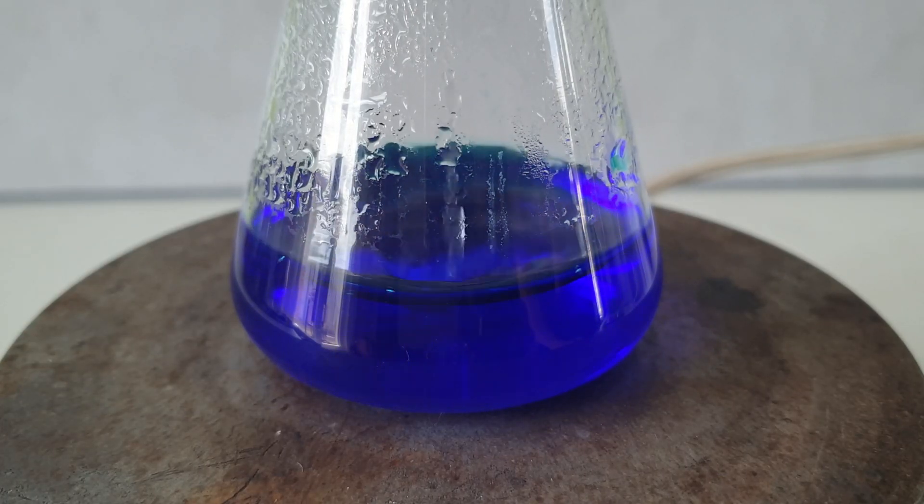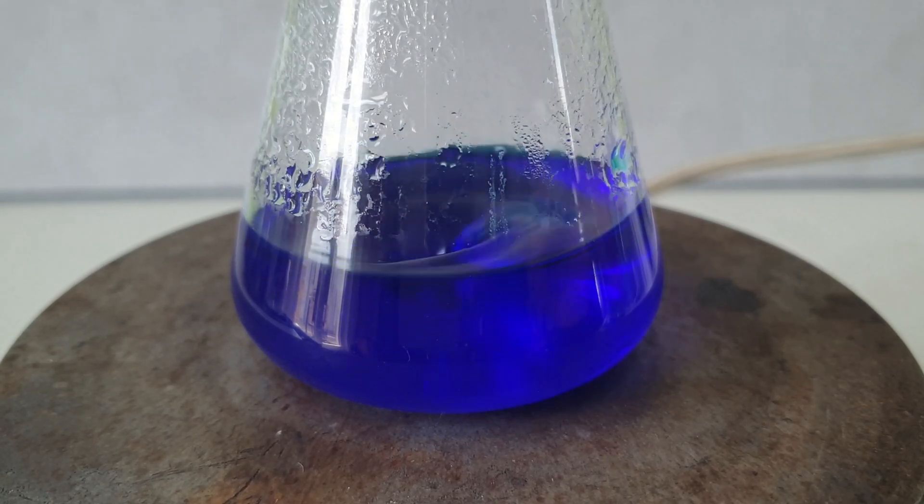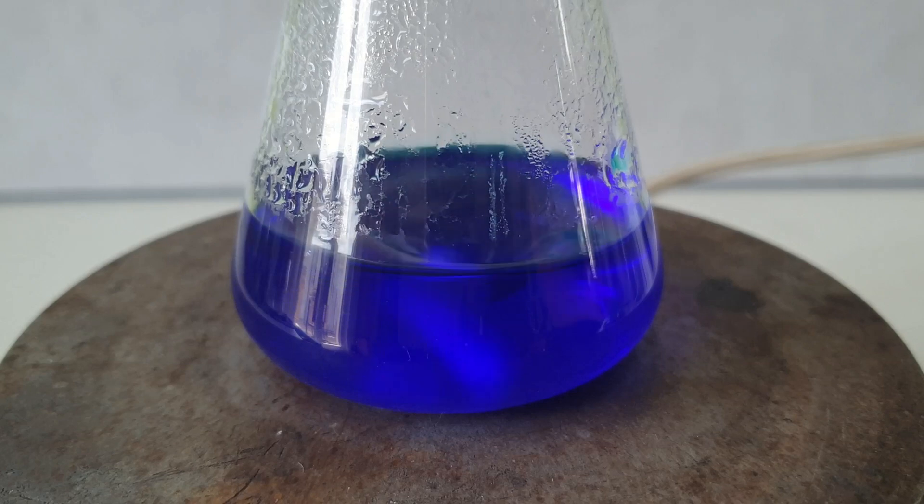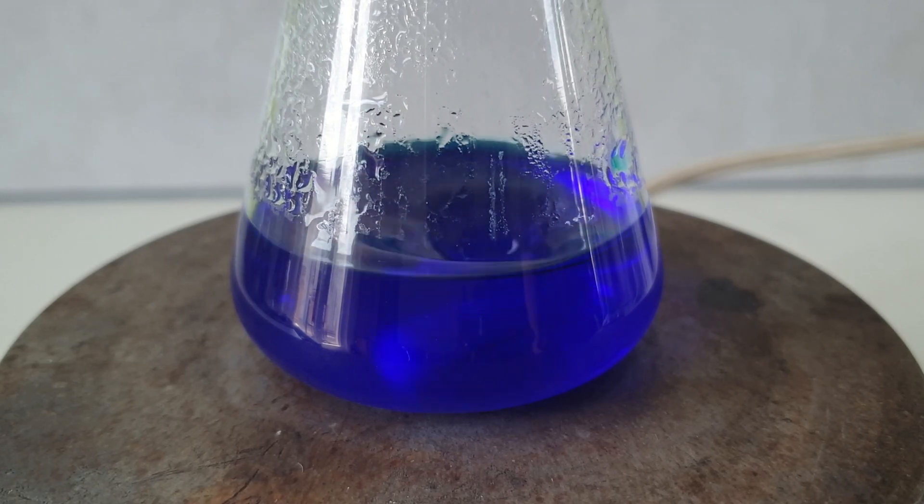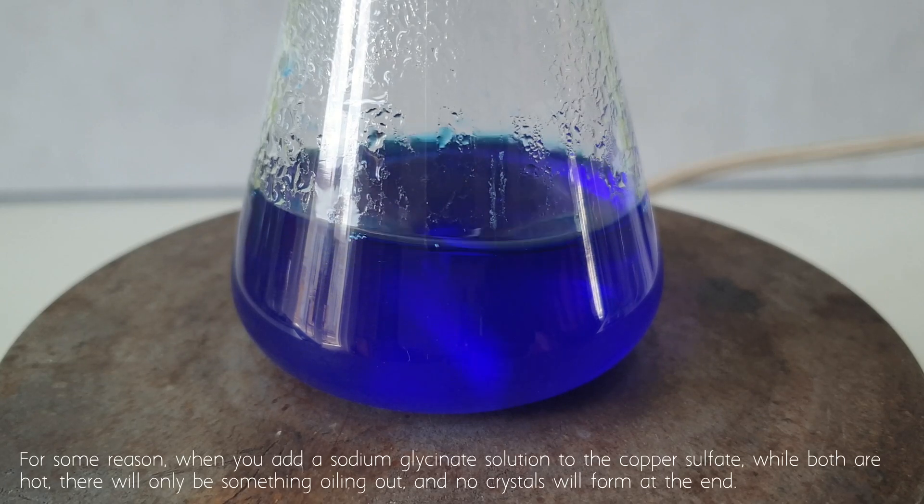Now while the reaction mixture is hot, I start neutralizing it with 1 molar sodium hydroxide. You can also use more concentrated solutions of sodium hydroxide. The more concentrated the solution, the less you need to add.